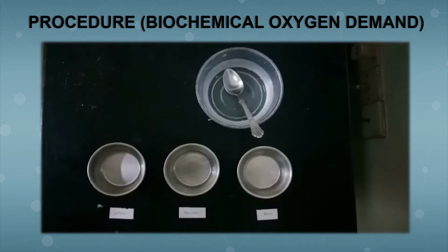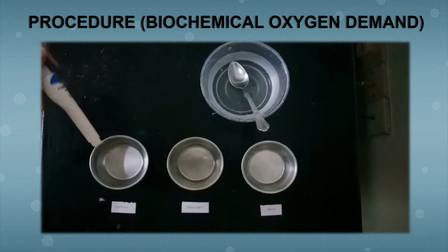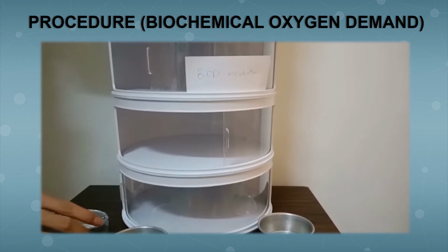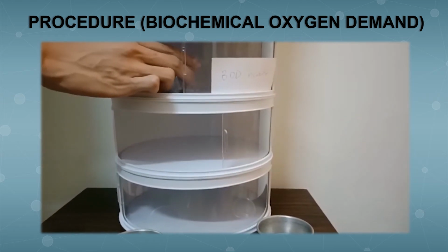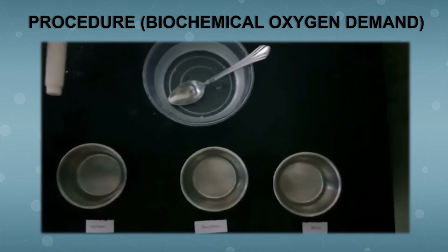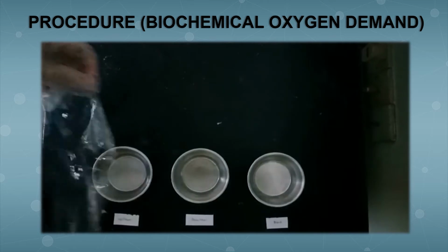Measure the initial DO level for each water sample by using the oxygen meter. Before proceeding to another water sample, you have to clean the oxygen meter with tissue and water. Put the BOD bottle into the BOD incubator, and make sure that the BOD incubator is set to 20 degrees Celsius. After 5 days, check the final DO reading for every water sample by using the oxygen meter, and seal the mouth of the BOD bottle by using a sealing film.